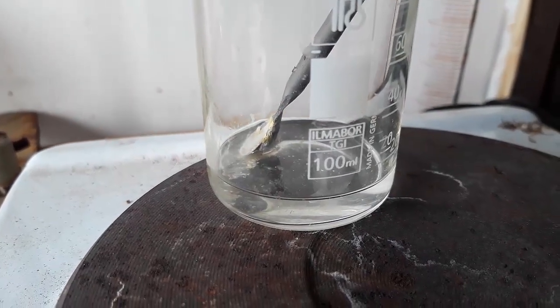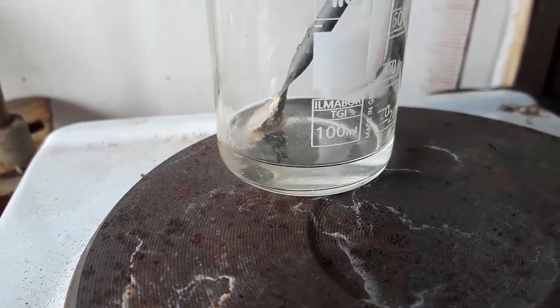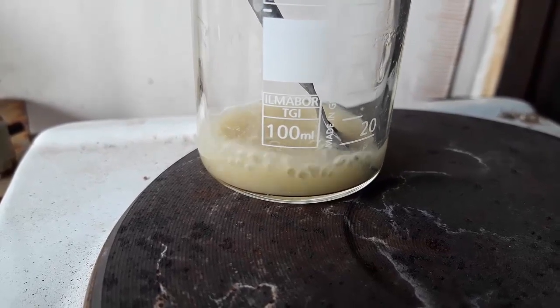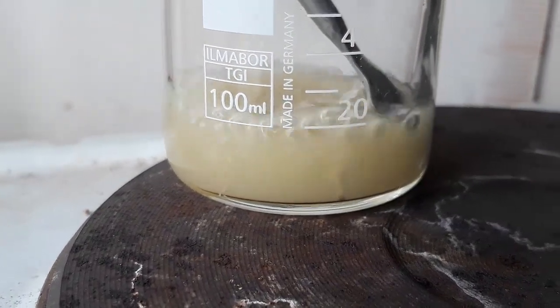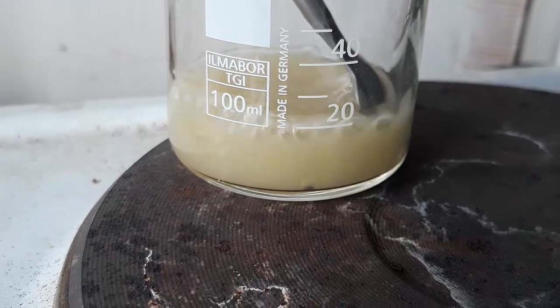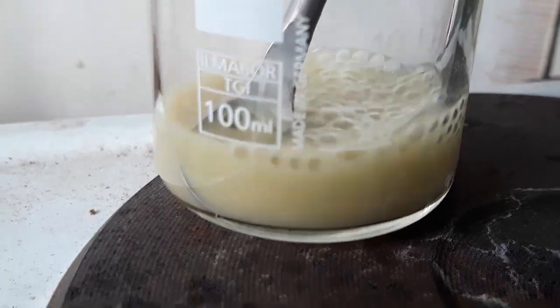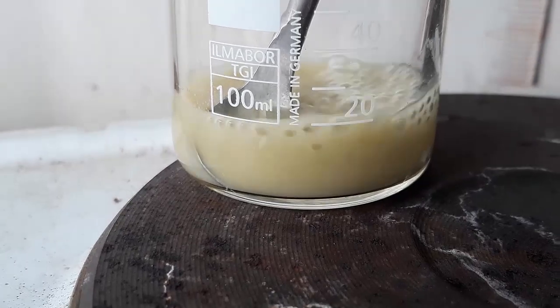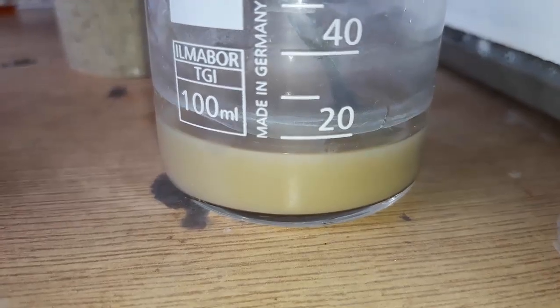Let's do a couple of tests. First, one paper stated that it could be recrystallized from ethanol, so we measured out about 10 milliliters of ethanol and added approximately 100 milligrams of our product. It's hard to say if we got some impurities, a suspension, or just an opaque solution. I added 10 more milliliters of ethanol and then an extra 200 milligrams of product to see if it would crystallize out when cooled, but when I did cool it down it stayed the same — basically no crystallization.